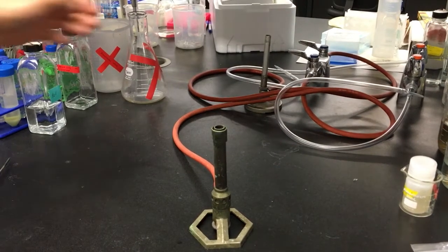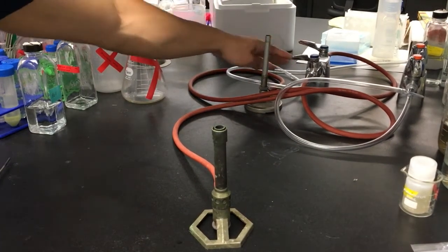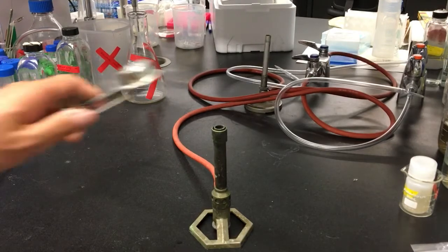Hi everybody, in this short video I'm going to show you how to make a spreader for spreading cells onto an agar plate.